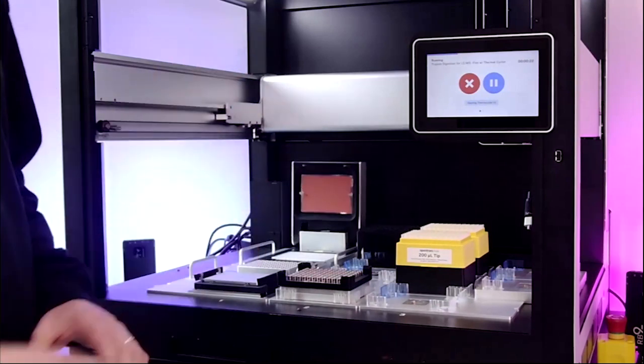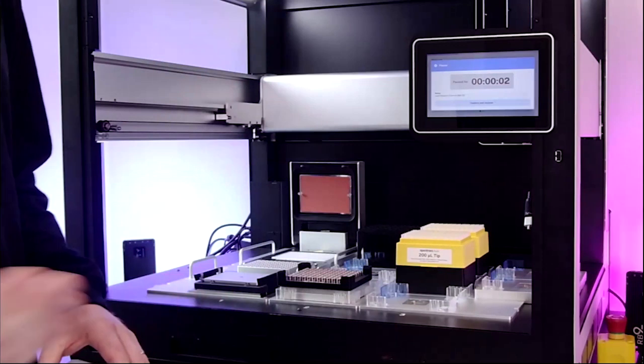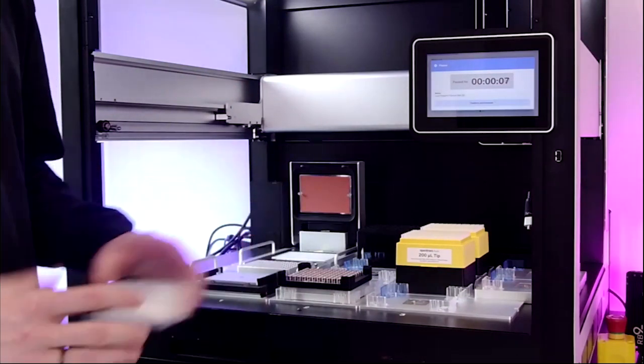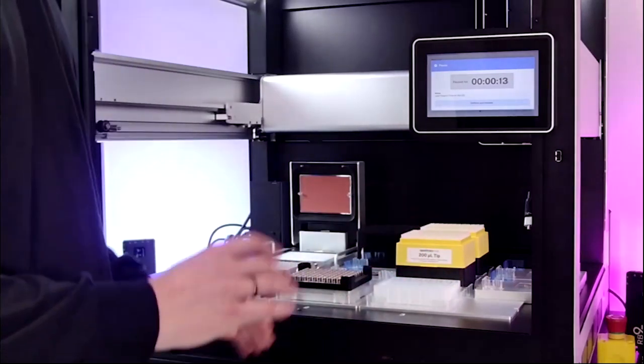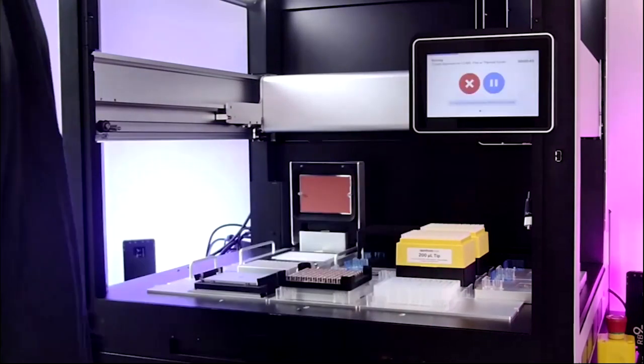And so this is another great example of how helpful the touchscreen is, so that you can be keeping your reagents somewhere else, refrigerated. You could even not have them prepared until this screen pops up and the protocol will pause for you. And then without interacting with your computer whatsoever, you can confirm and resume.